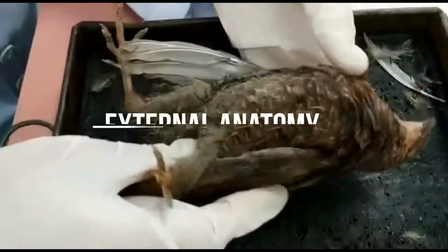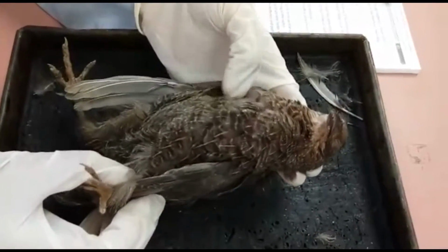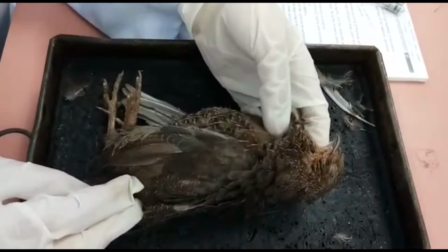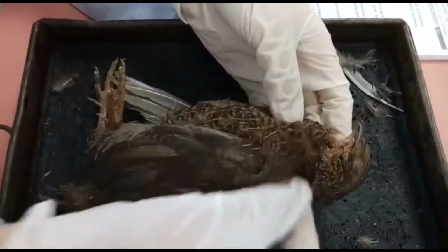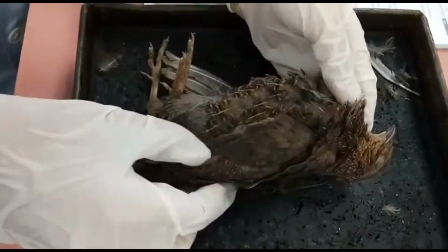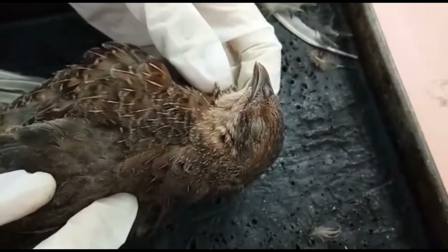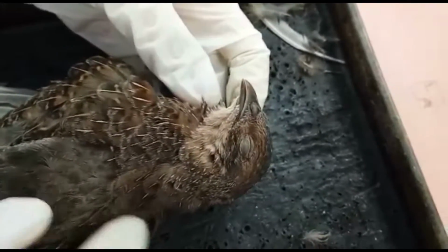Okay, this is the bird that we obtained for this dissection of bird anatomy. The external anatomy of this bird can be divided into 4 parts, which are the head region, the neck region, trunk, and tail. In the head region, we can observe the beak. The beak consists of 2 parts, the upper beak, rostrum maxillae, and the lower beak, rostrum mandibulae.